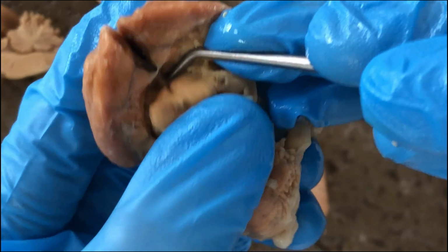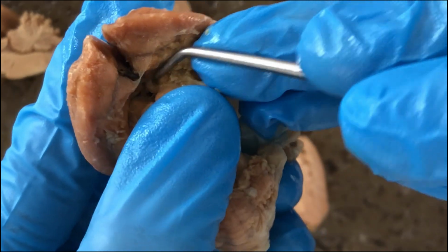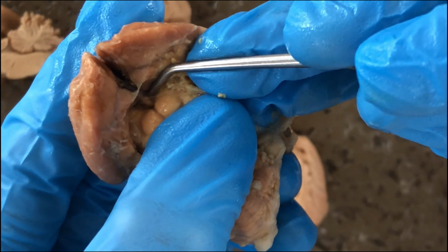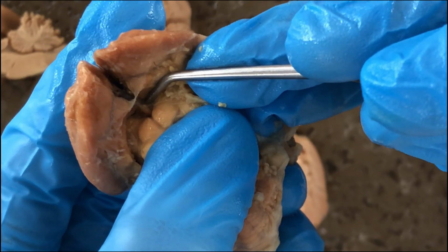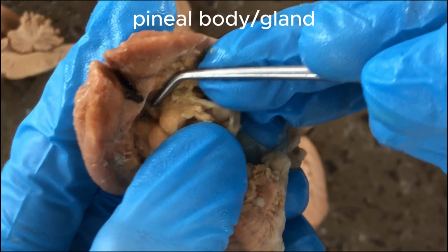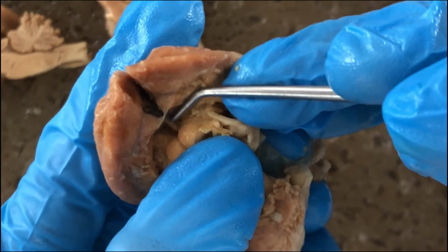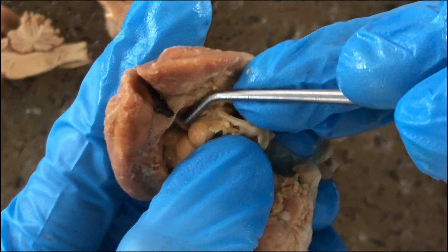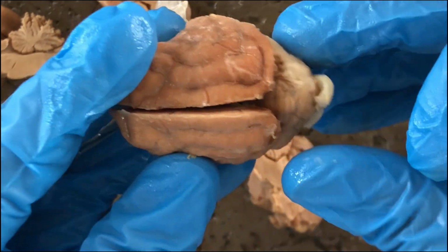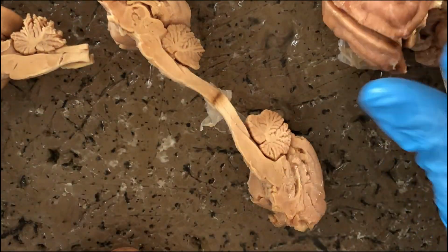There, you see there. So this would be your superior colliculi, but deeper there is part of the epithalamus, called the pineal body or the pineal gland, which secretes a hormone called melatonin, which regulates body clock, the circadian rhythm of the animal. So it's a pineal body.